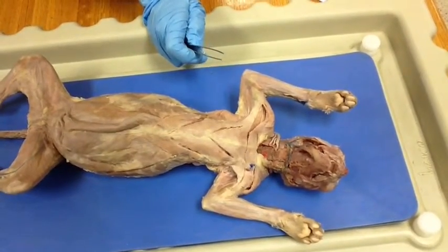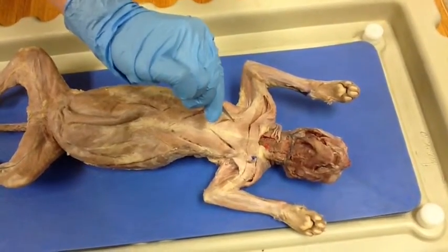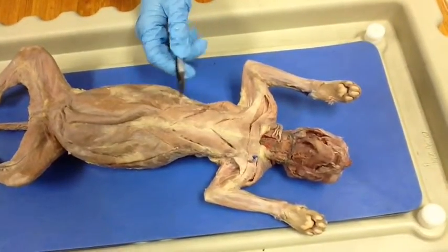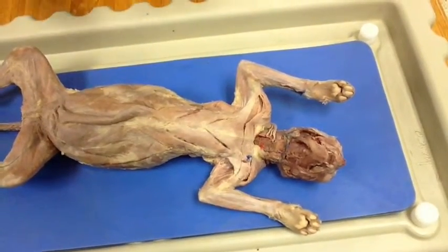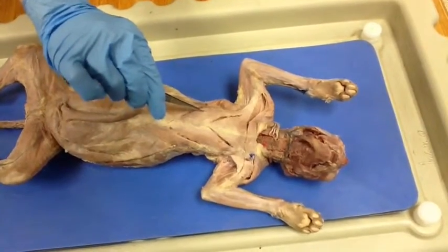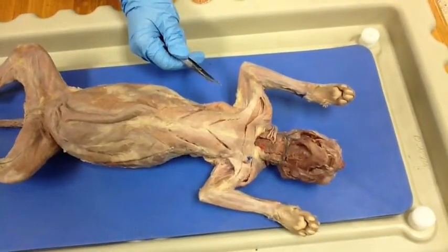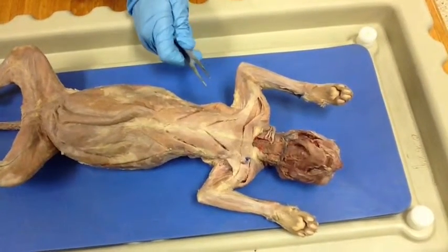Then we have the pectoralis major, which is right here, and it does the same thing as the pectoantebrachialis, and the insertion point is the humerus, and the origin is the anterior part of the sternum. Then next we have the pectoralis minor, which is the same as above, and it also inserts in the humerus, and the origin is the mid and posterior part of the sternum.